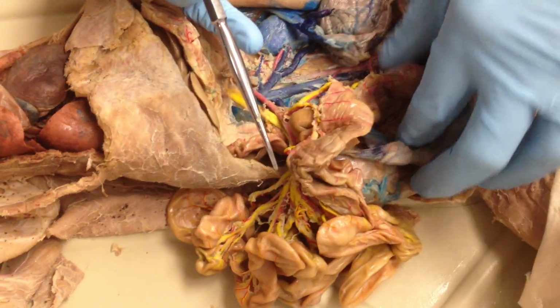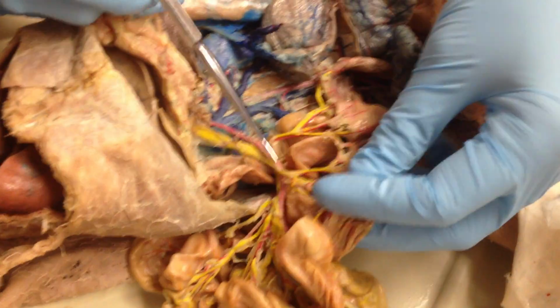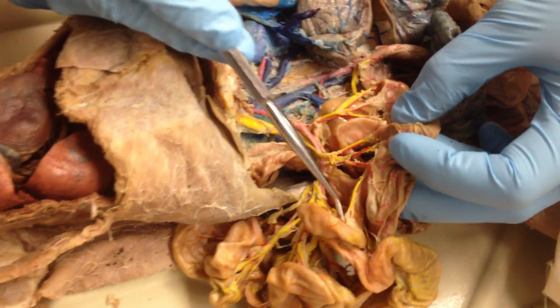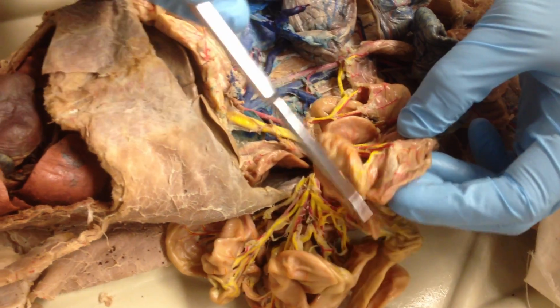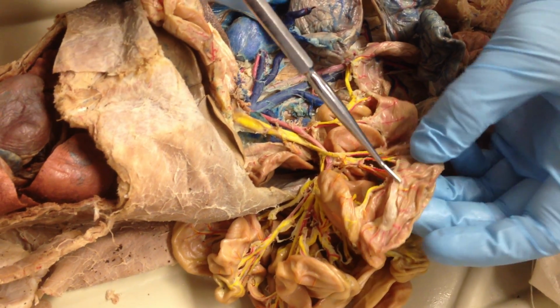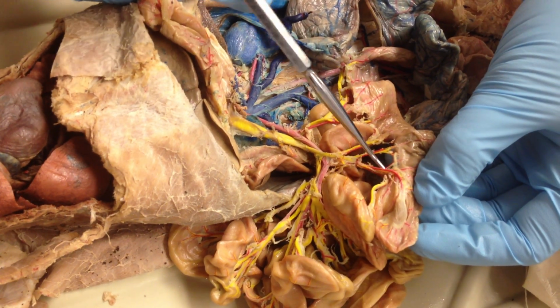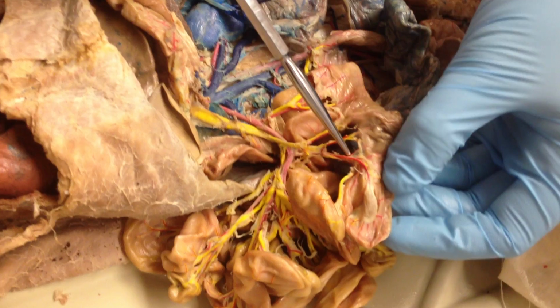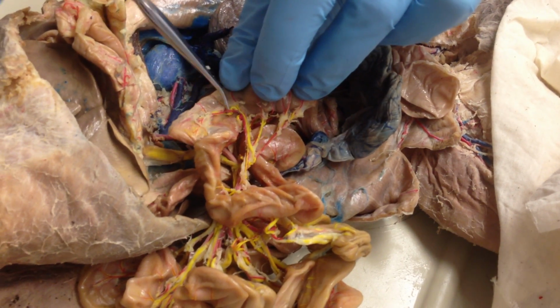Now for the artery. And these differ slightly between arteries and veins. Superior mesenteric makes a couple branches. The first one goes straight and onto the cecum portion of the large intestine. So this here is the ileocolic. Now that splits, and on the back side goes to the back part of the cecum, and that's the right colic, artery and vein.